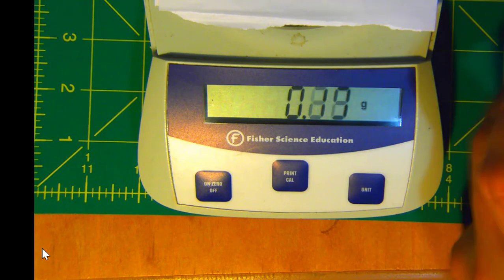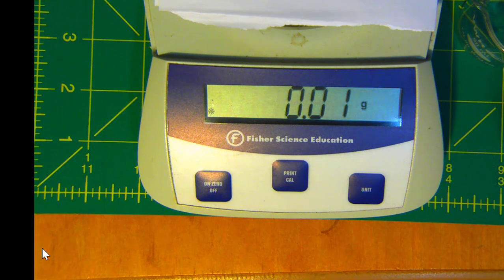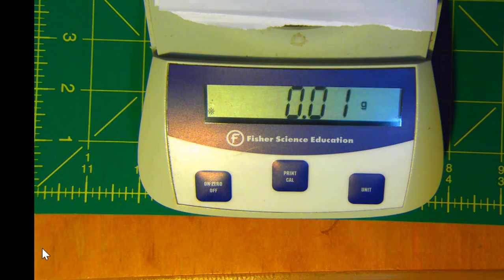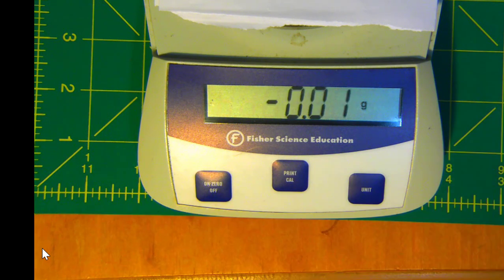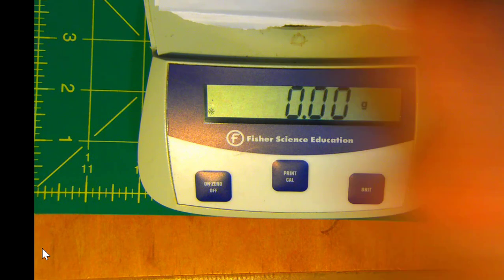And then we'll take that off, and as I mentioned, we're going to add some sand to this instead of the sugar. So there's a little bit of sand, and you know what, it looks like we are a little bit off now, so I'm going to re-zero that. I can tell you what probably happened there. I was probably too close to the balance when I did that, and some of the sand dust might have interfered with the measurement. So let me go ahead and put this back on.